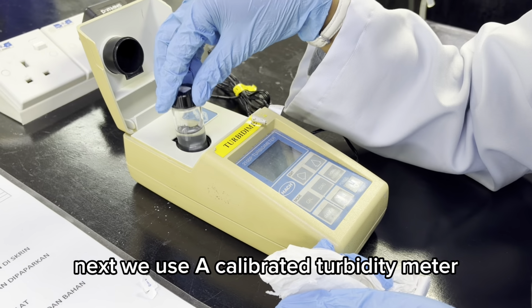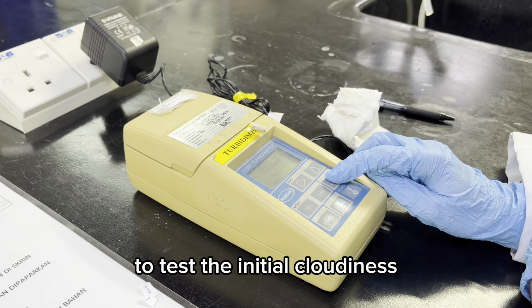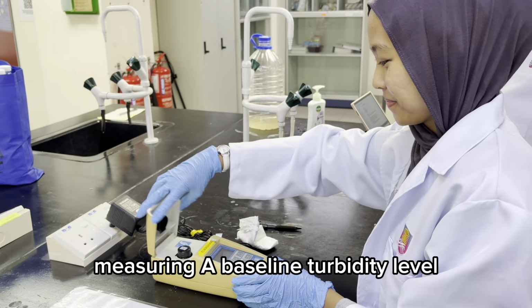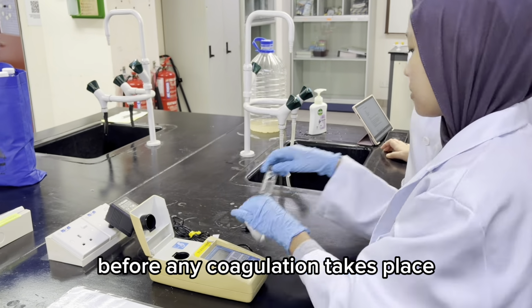Next, we use a calibrated turbidity meter to test the initial cloudiness, measuring a baseline turbidity level before any coagulation takes place.